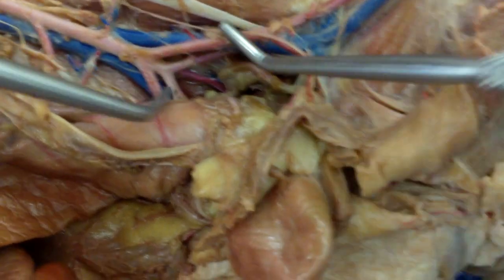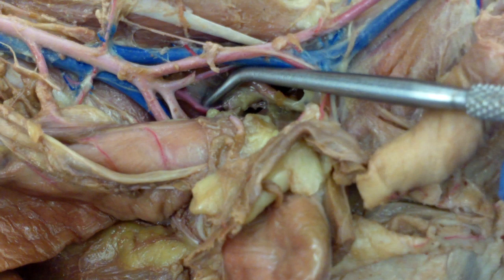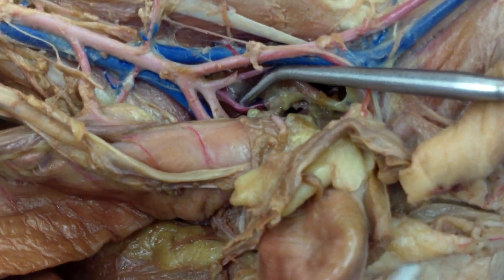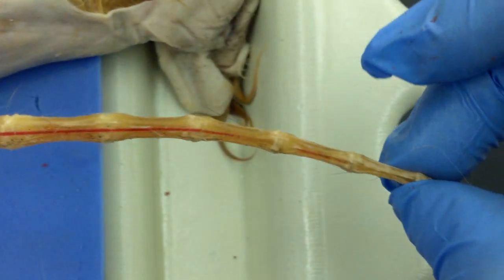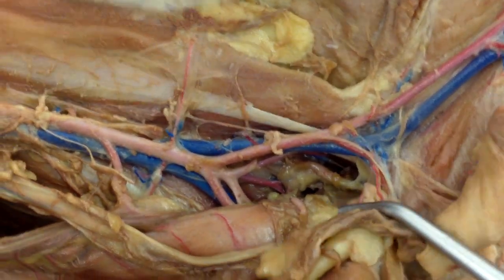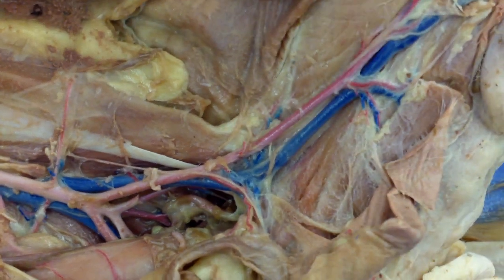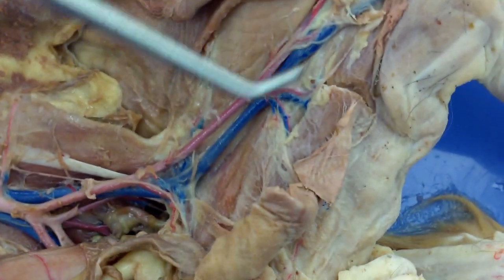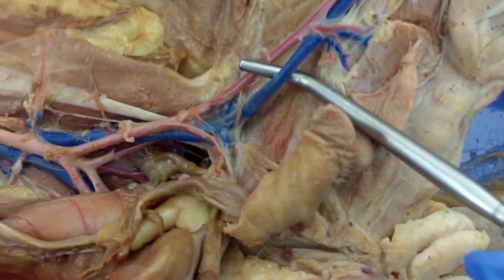And then buried way deep underneath there, you have your caudal — this guy right in the bottom there, which goes all the way down to the tail. Continuing along the external iliac, that turns into the femoral right down here, and that goes down the leg. And then you have the vein coming back up — the blue one — that's the saphenous vein.